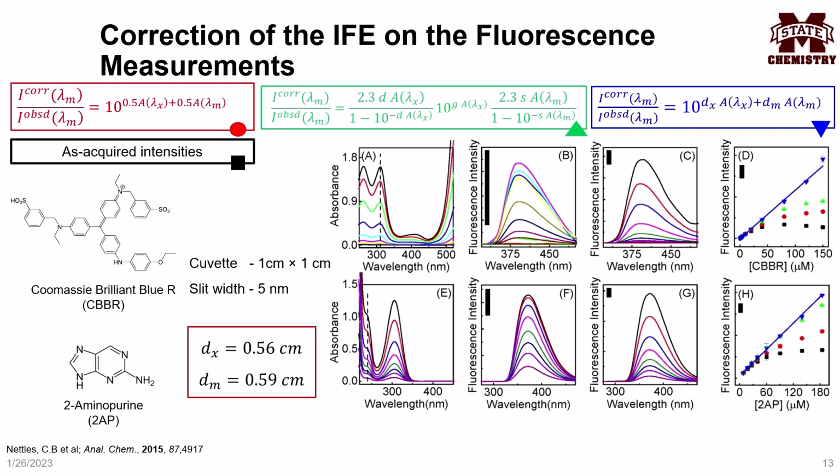Figures A and E show the UV-vis absorption spectra. B and F are the as-acquired fluorescence spectra, and C and G are the inner filter effect corrected fluorescence spectra. D and H show the correlation between peak fluorophore intensity as a function of the fluorophore concentration. In D and H, the black dot shows the trend line at 300 nanometers for the as-acquired intensity.